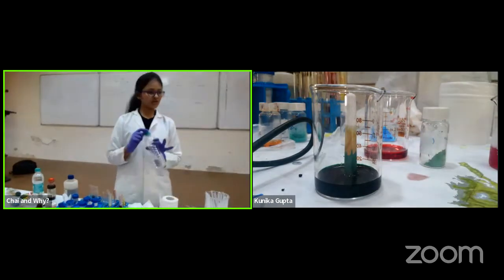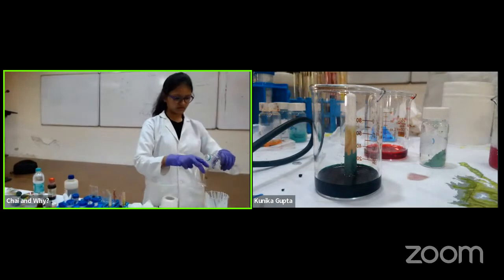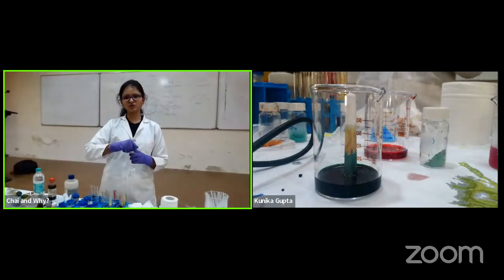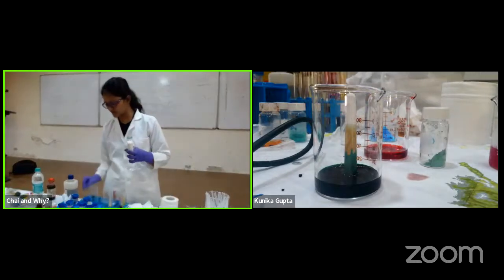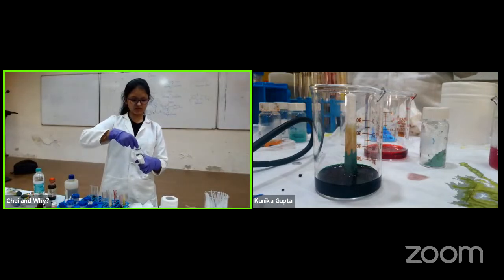So this is a water bottle, simple, the water which I was using so far. Now I'll take a beaker. In this I'll mix glucose. This glucose is normal glucon-D that you have, but I have taken it from the lab. But you can do it anyway. You won't be able to do this experiment at home. So I'll make a glucon-D solution.